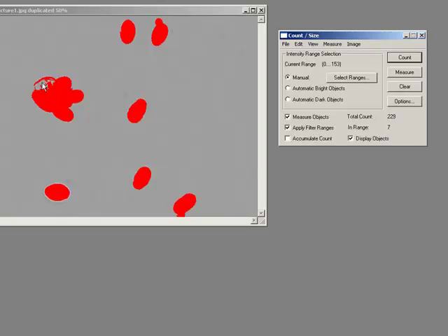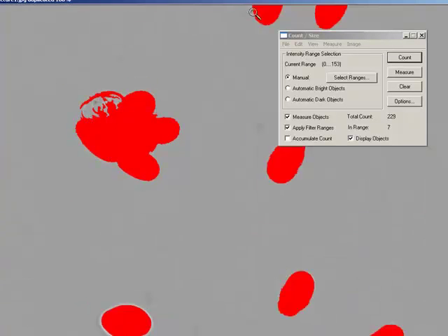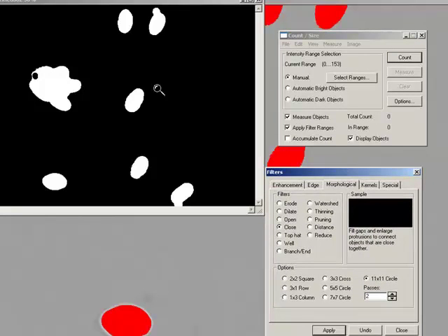But I still have this problem here. My problem here is that I can't actually get my object to fully connect. So because it's not fully connected, it's not filling it as a whole. So if I now just say, make a mask of that, now I'm in a binary world, and I will just run a very simple close filter. In fact, I'm going to need to run it again. So a close filter of 2. There we are. Now I've significantly used that close filter to swallow up that hole.